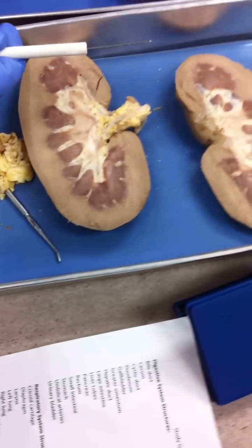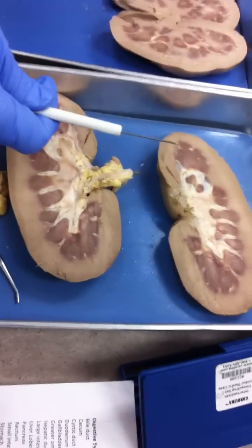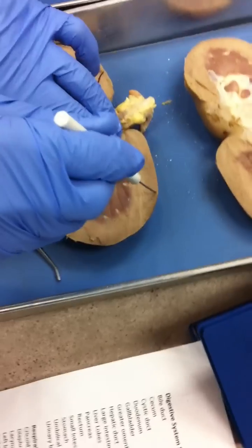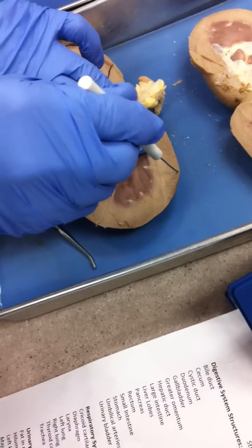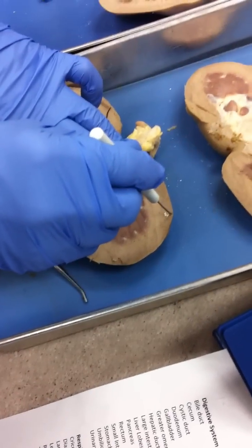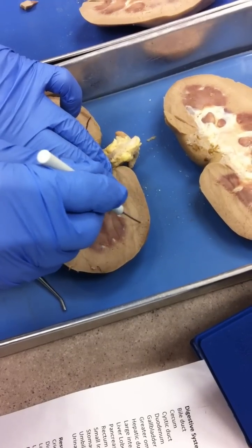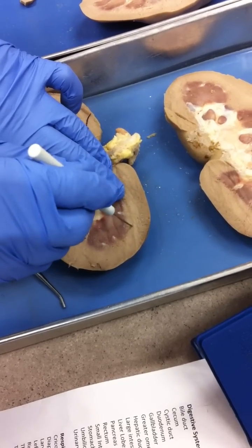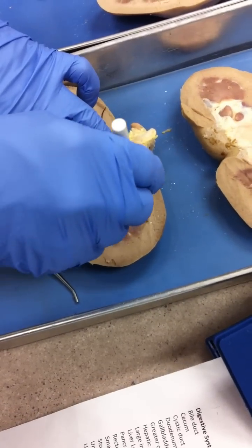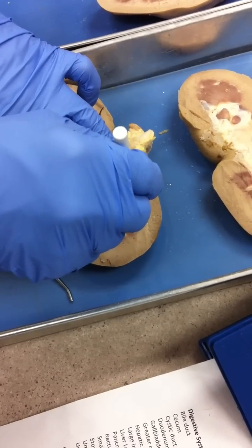The word cortex and medulla refers to what? Cortex refers to the outer layer; medulla refers to the inner layer. I'm simply going to have a pin right in here, right on the edge — that's the renal cortex. I'm going to have a pin about a half an inch more towards the medial, more towards interior — that'll be the renal medulla. You'll see two pins there: cortex and medulla.